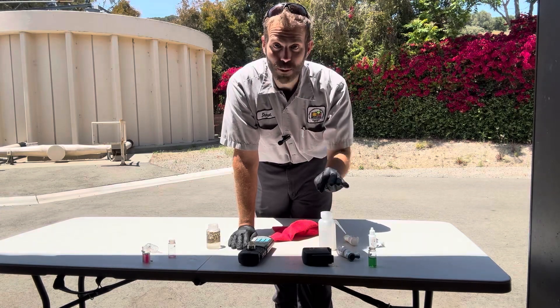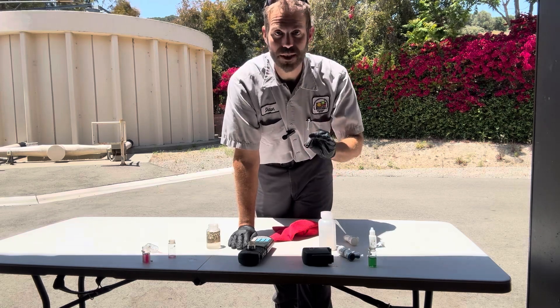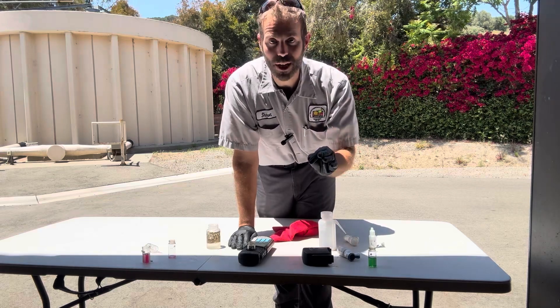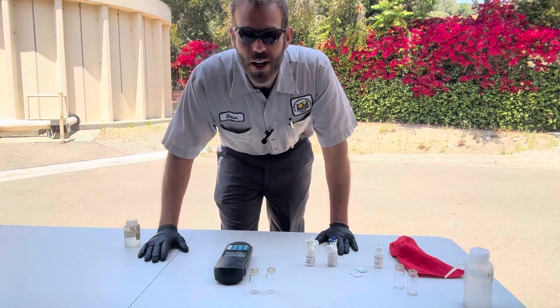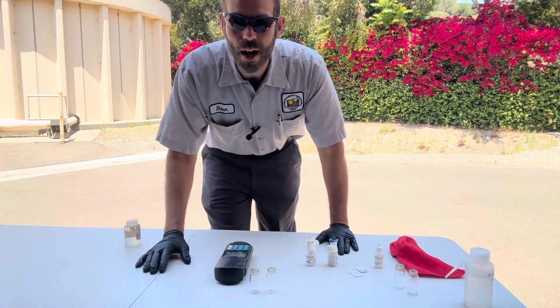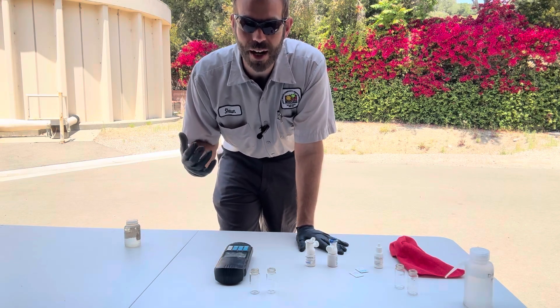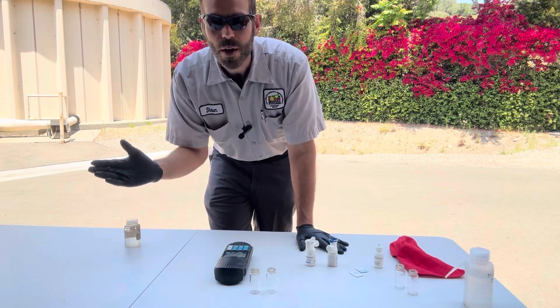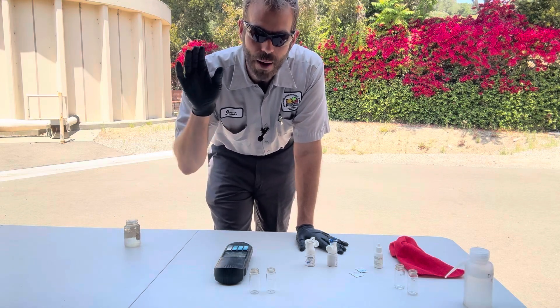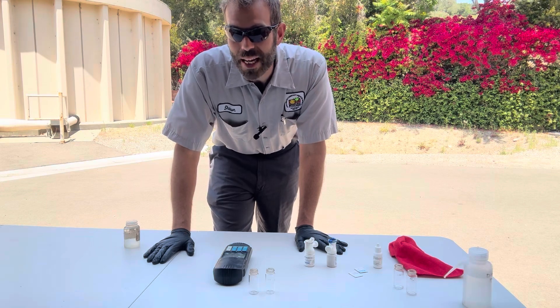This is how I determine where I am on the breakpoint in real time. This is not theory, this is not whiteboard stuff - this actually just happened and I was super excited to take you along. Welcome back everybody. I'm going to do a little field test. I put out a breakpoint chlorination video a while ago and I've been waiting for an opportunity to show you what I mean when I've got low chlorine and I don't know which way to go - do I add chlorine or do I back off the chlorinator?